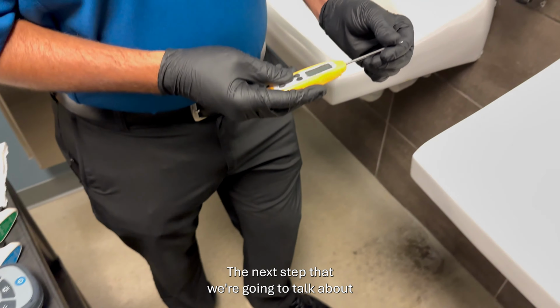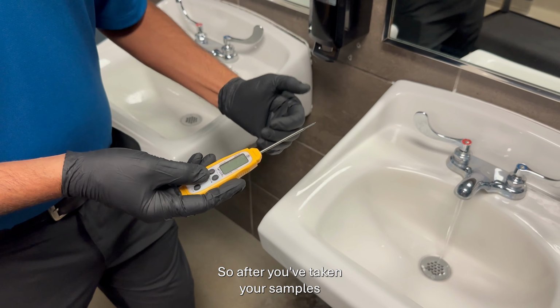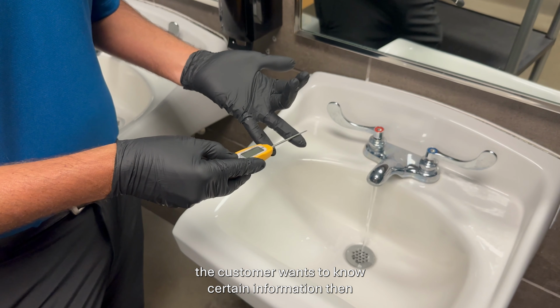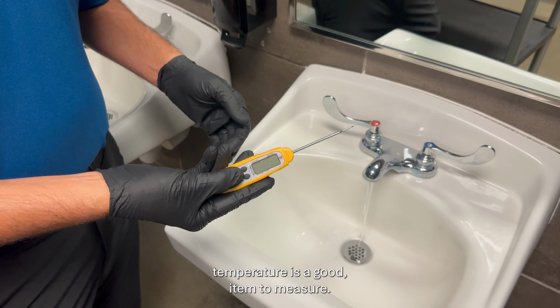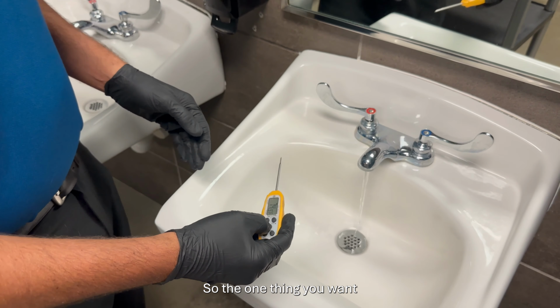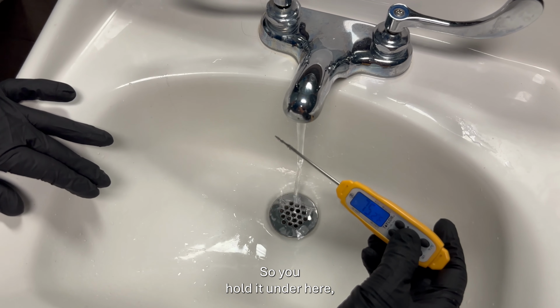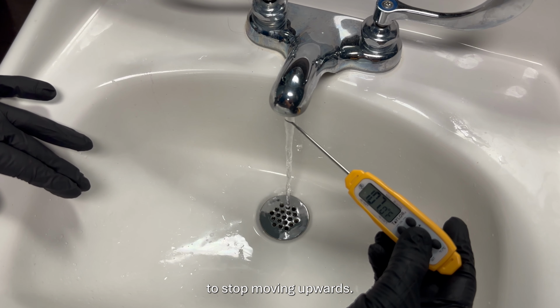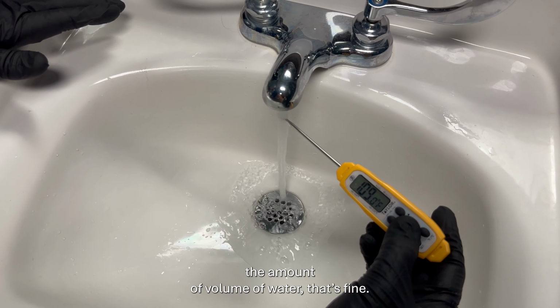All right, the next step that we're going to talk about is doing field measurements. So after you've taken your samples, if your water management program requires it, or if the customer wants to know certain information, then temperature is a good item to measure. The one thing you want to do is run your water until its temperature stabilizes. So you hold it under here, you get a good temperature, and just wait for it to stop moving upwards. If you need to increase the volume of water, fine.